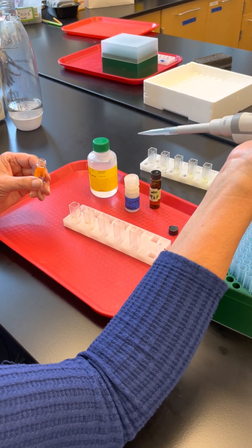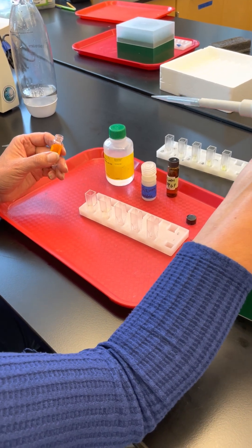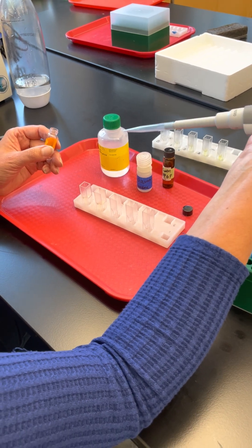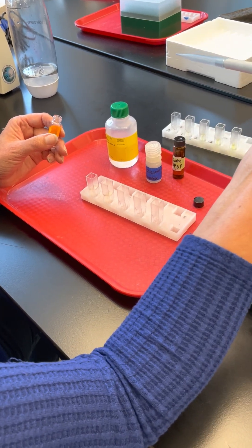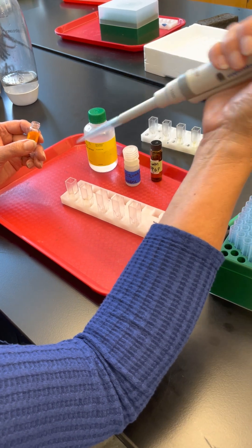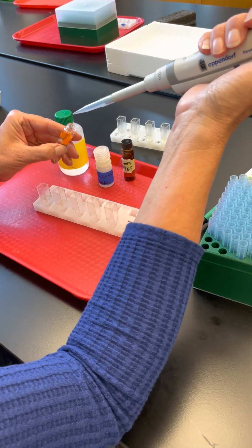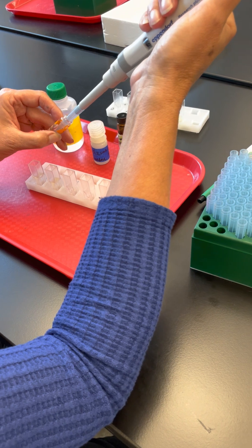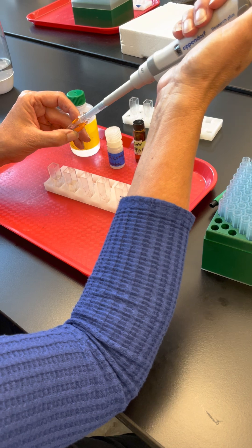It's very important that you measure accurately. That's why we'll start with measuring water and weighing it to confirm you're pipetting correctly. If you're not measuring accurately, everything will be off. We'll do this in pairs today or tomorrow, and then again individually, because we should all get the same rate since we're using the exact same enzyme and substrate.